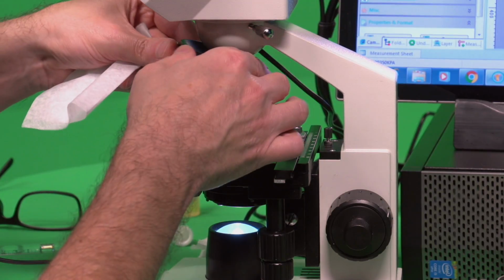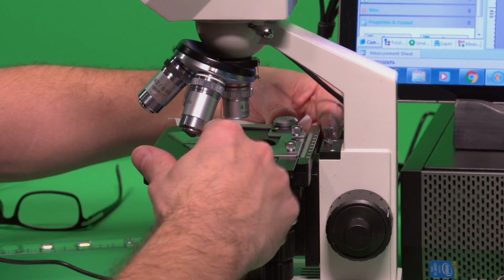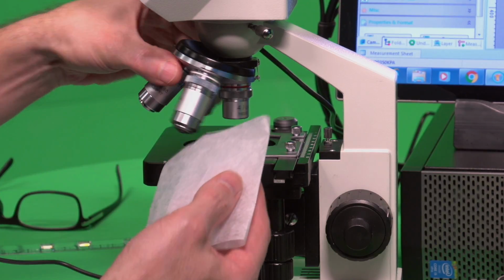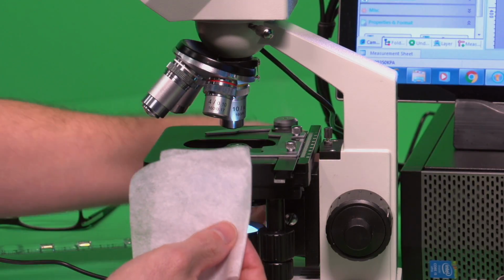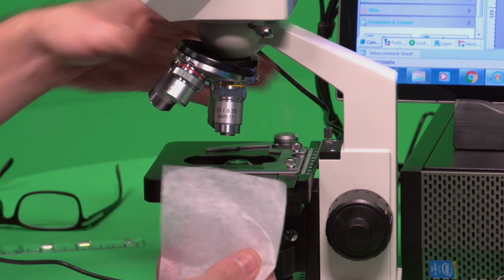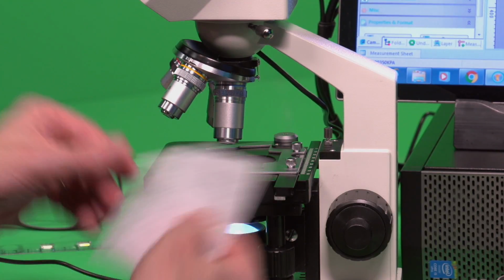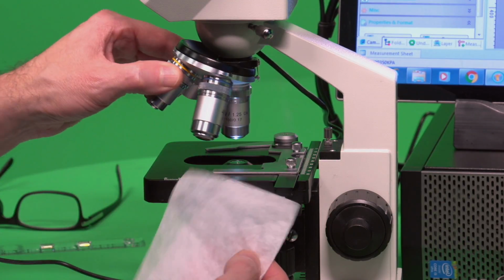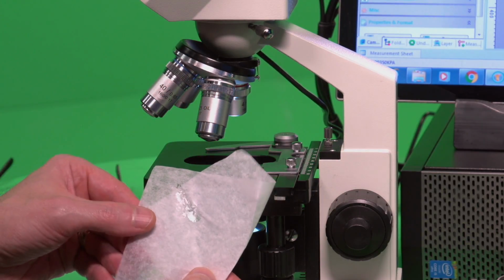So I'm going to go ahead and move the 4x objective into place. I'm going to go ahead and pull my slide out of the area. And then it's really important, if you look at this new lens paper, right, if we do this to the 4x objective, there's no oil on it. There shouldn't be. I'm going to drop the stage down all the way. 10x, no oil on it. 40x, no oil on it, but you should still always check, because if you're going back and forth between 40x and 100x, you may have got oil on the 40x objective. And then the 100x, we can see that oil on there.